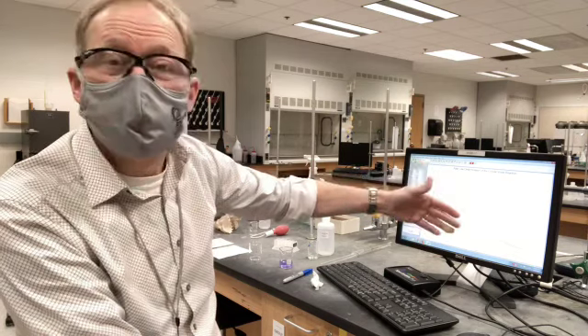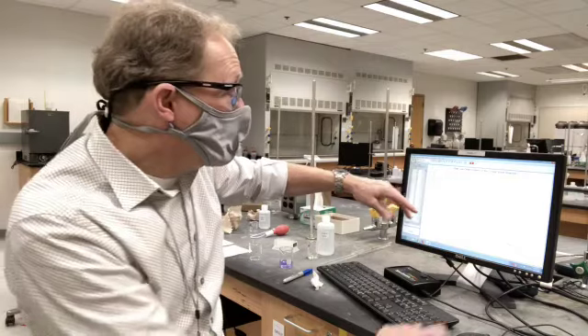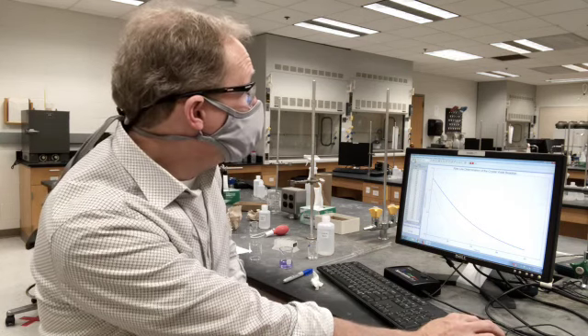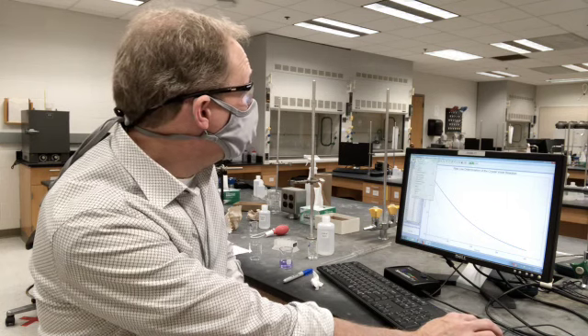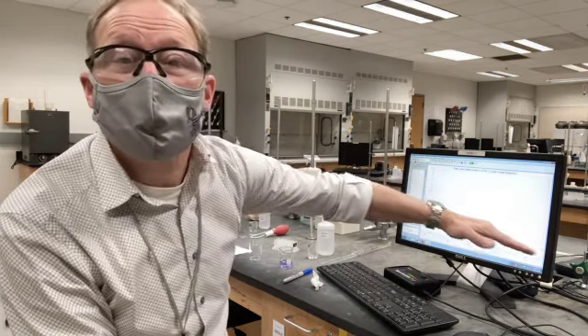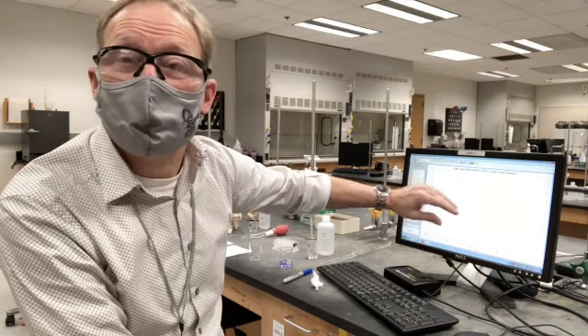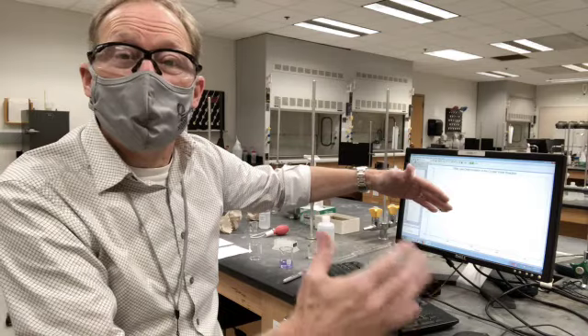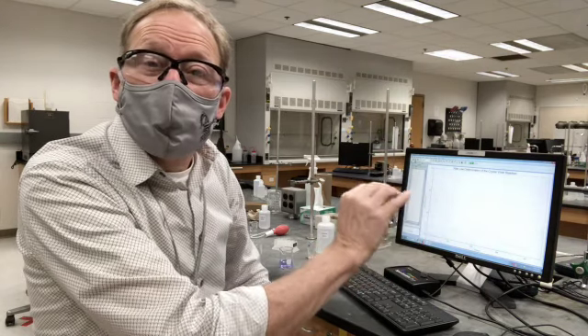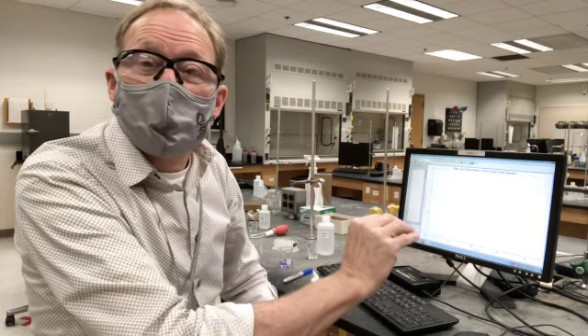It's going to help you to determine the rate constants and the exponents for the rate law. We're down to 0.12 — that looks pretty good — so I'm going to stop it now and store the latest run. Now you can see that when we put less hydroxide and we lowered its concentration, it also meant this took longer, and it means that the effective rate constant for that second run is going to be lower. By fitting, we'll be able to figure out quantitatively how much lower. Best wishes as you analyze this — I will post this file on Moodle so that you can download it and open it in LoggerPro. If that presents trouble, contact your lab instructor by email and we'll figure out how we can make that work best. Okay, all the best.